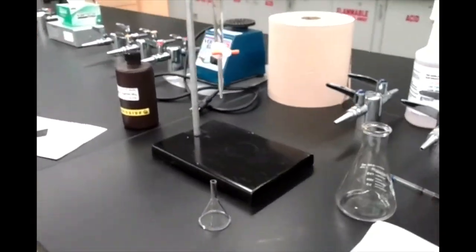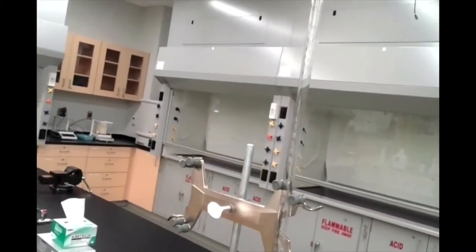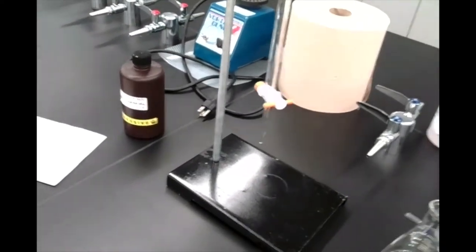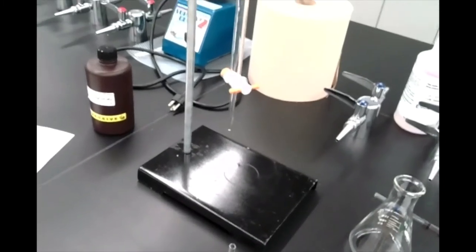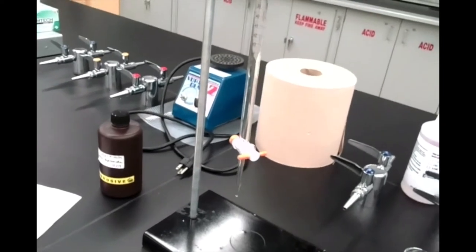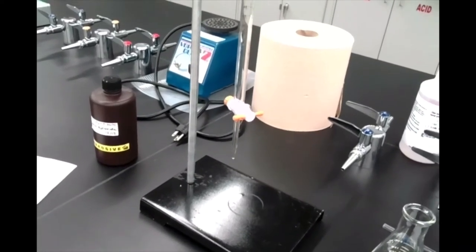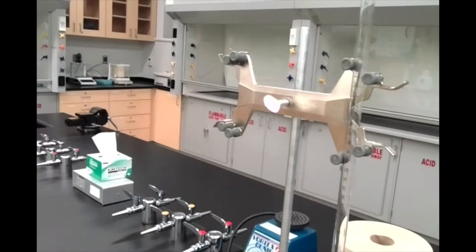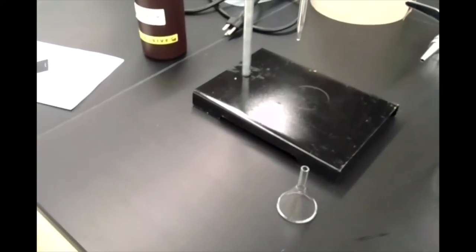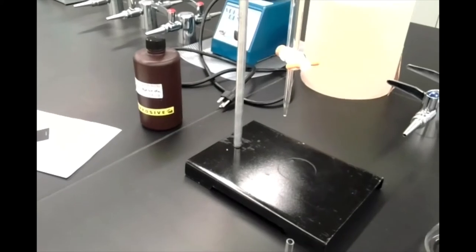The other piece of equipment we're going to need is called a burette — it's this long glass tube that's open on one end with a tap called a stopcock at the bottom. We can use that to control the titrant we allow to run through it. Our titrant for this experiment is the sodium hydroxide I mentioned earlier, and we'll make note of the volumes we add through our burette to our vinegar.